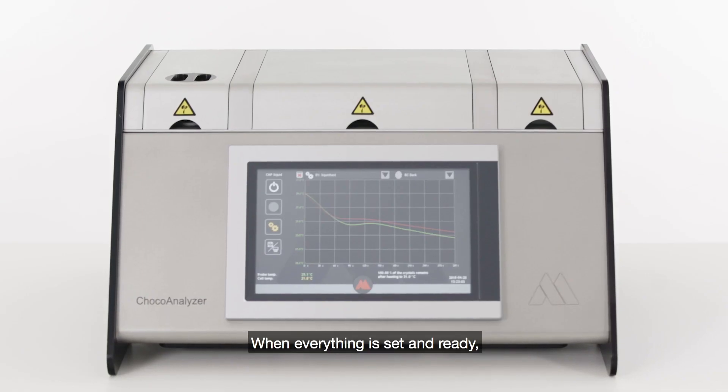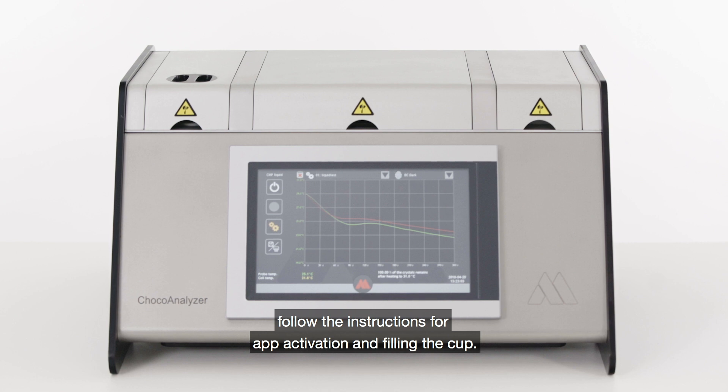When everything is set and ready, follow the instructions for app activation and filling the cup.